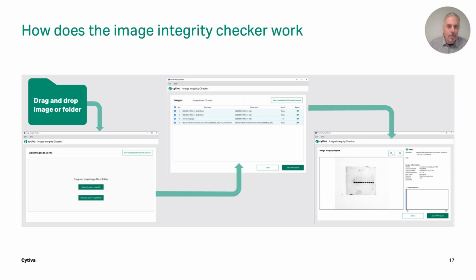So how does the Image Integrity Checker work? Basically, you can take a single image or a folder of images and drop them into the tool. It's going to run through incredibly quickly and give a pass or fail. If it's from a different imaging system, it will just say not recognized, and it's not within the realms of the tool to pass or fail whether anything had gone on with that image.